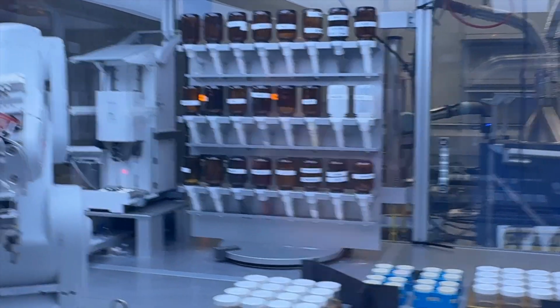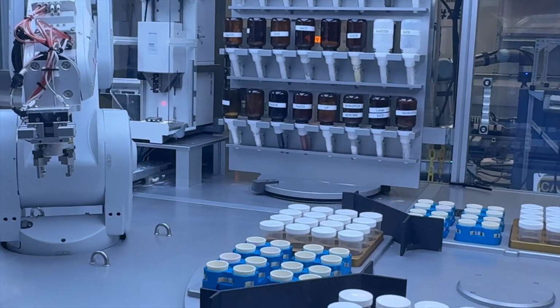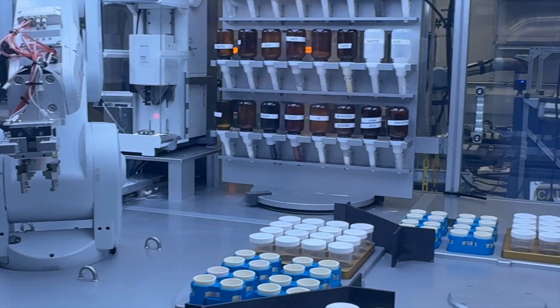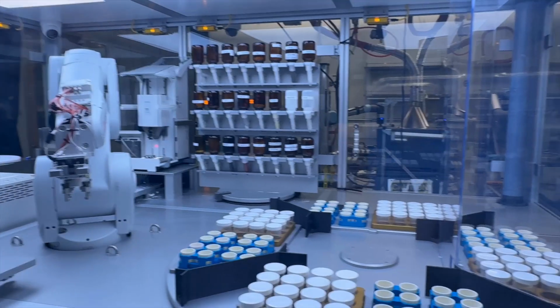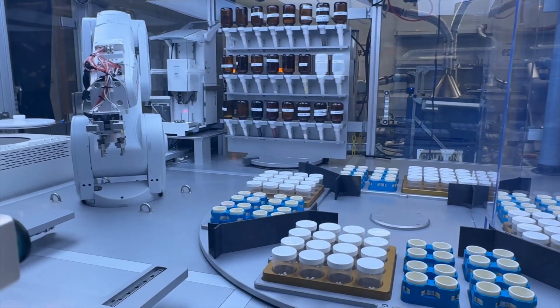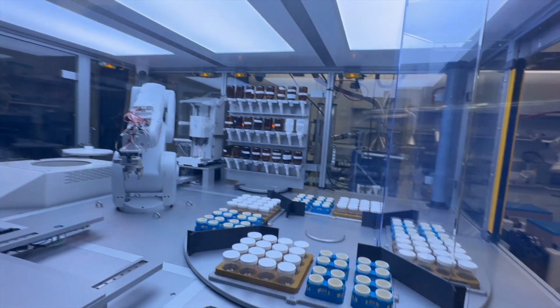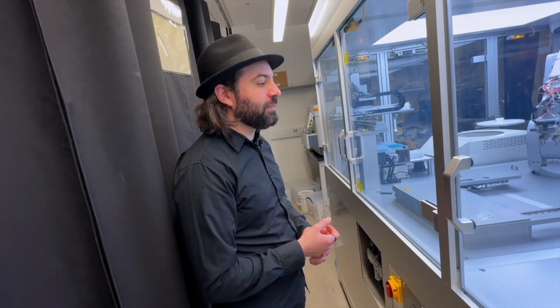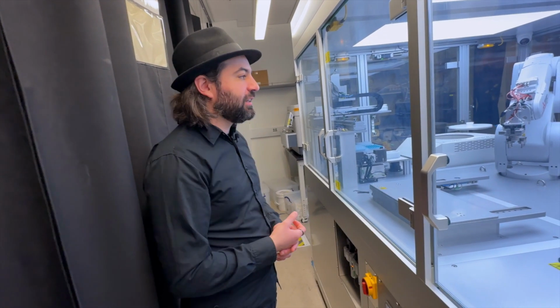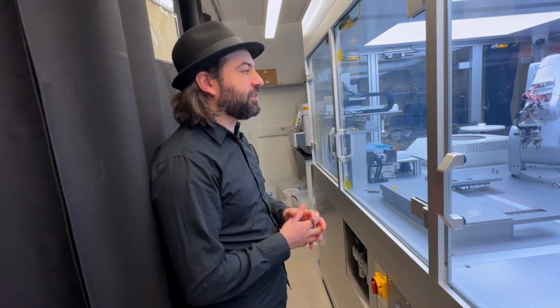So there's also really an inventory thing that you have to manage as well, making sure that, as these computers have different hypotheses for what they want to be creating, there's ample supply of that. Yes. How much of this material do they go through in a typical run? Oh, it's not a lot. The A-Lab makes very small amounts, right? So you're working on like 1 gram, 1.5, 0.8 grams. We usually make a small amount of materials per run. So they last a good time.